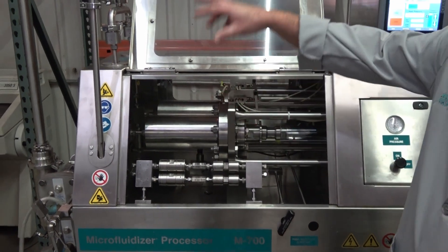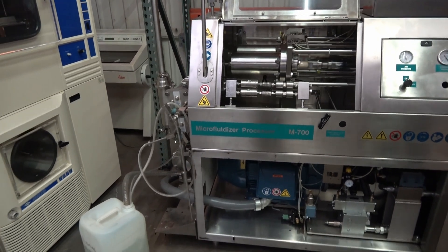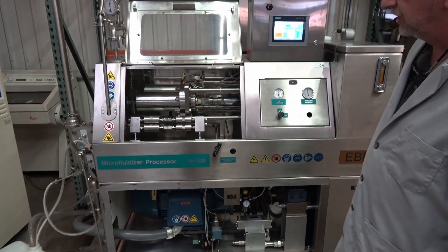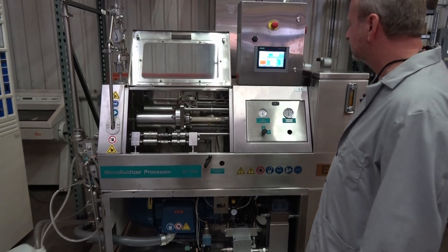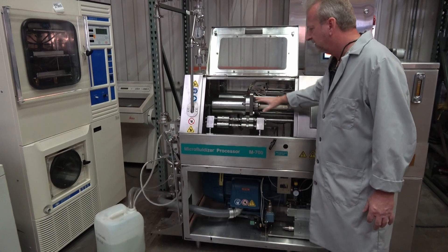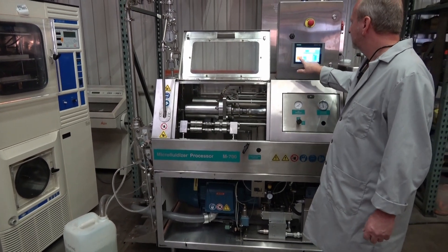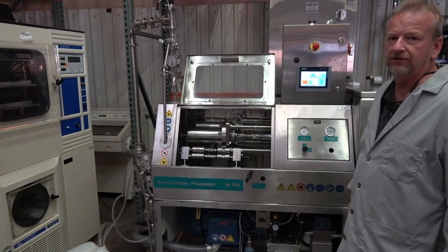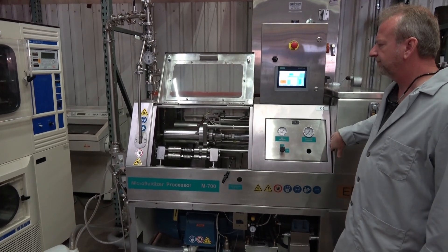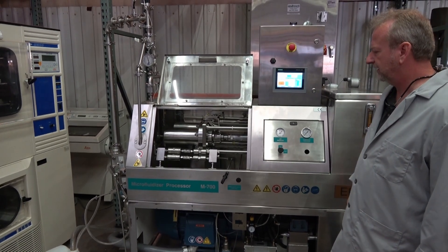All the plumbing is in place — you just hook up the machine to your fluids, pump them in, run it through the strainer, and bring in some chilling fluids to cool the hydraulic system. The quench fluids would also need to be hooked up. We're just doing a short run for demonstration since we don't have the chiller hooked up right now — it builds up heat in the hydraulic fluids pretty quickly.